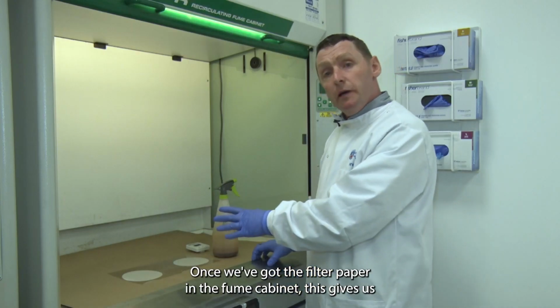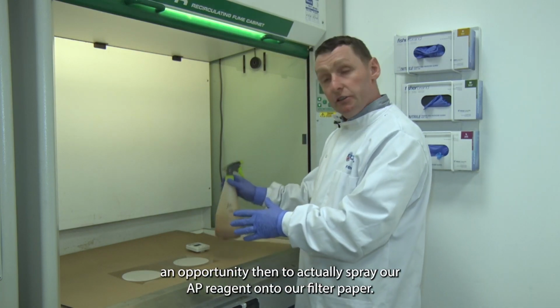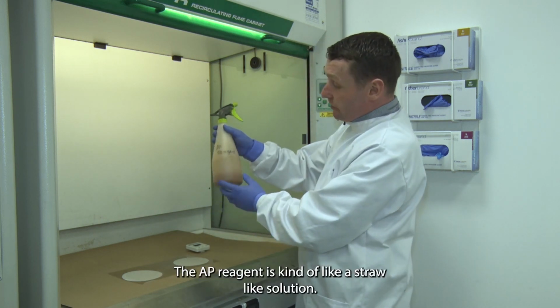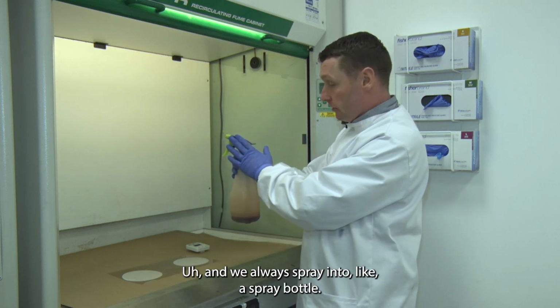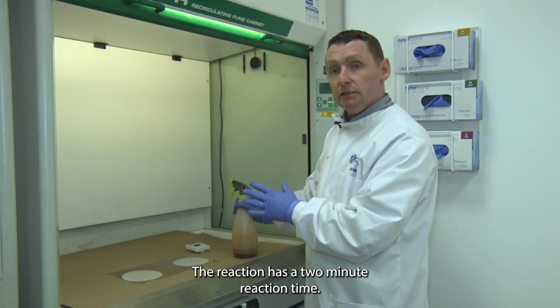Once we've got the filter paper in the fume cabinet, this gives us an opportunity to spray our AP reagent onto our filter paper. The AP reagent is a straw-like solution, and we always keep it in a spray bottle. The reaction has a 2-minute reaction time.